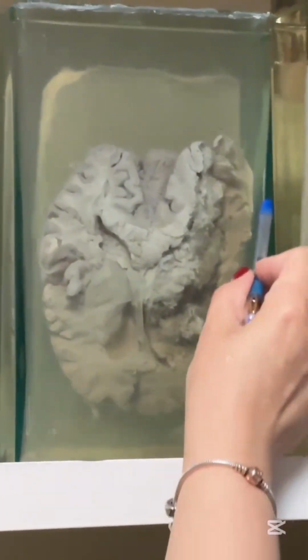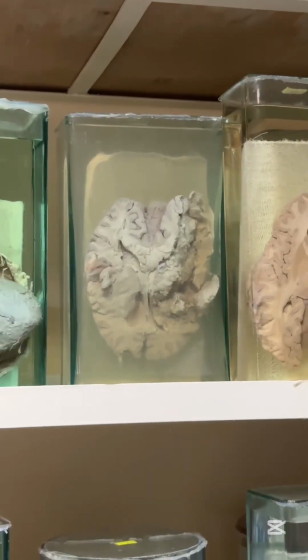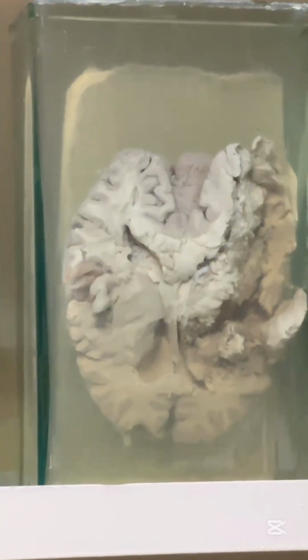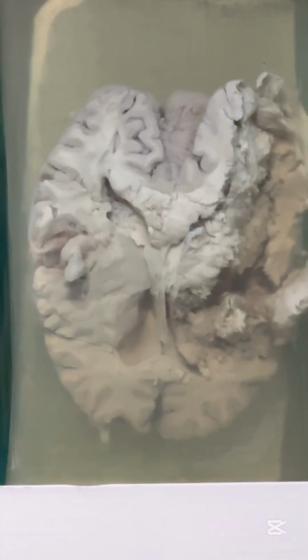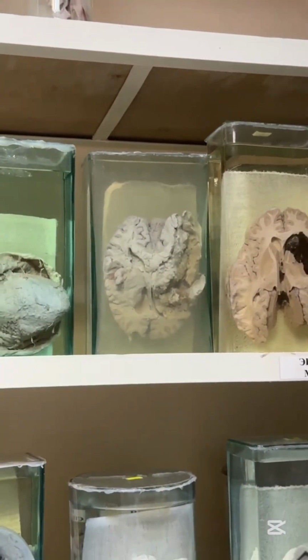serous membrane. Next one, that is brain, and you can see large area of destruction of brain tissue, that is ischemic infarction of the brain, and you should know characteristic of it. It is irregular in shape and pale in color. Pale, irregular. Microscopically, that is liquefactive necrosis, because of a lot of water in tissues. That's why liquefactive necrosis. Most common cause is ischemia due to atherosclerosis of brain vessels.